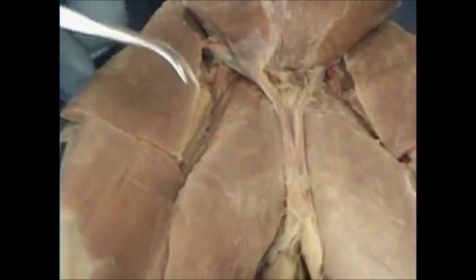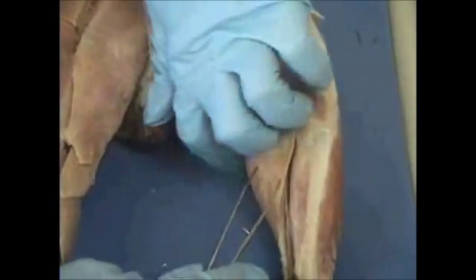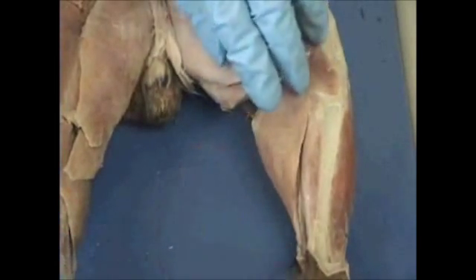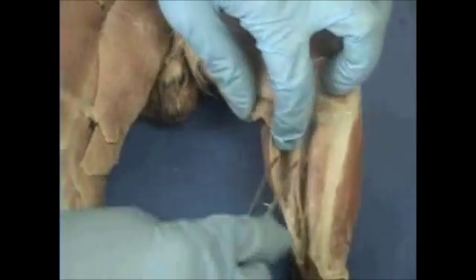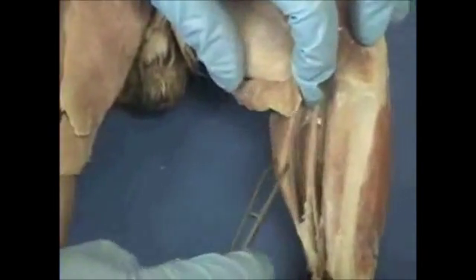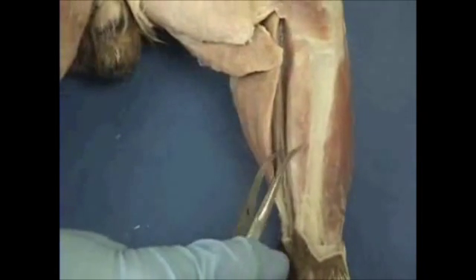Now let's take a look at the lower portion of the limb or the leg. Here we see our calf muscle known as our gastrocnemius — just like the human. The leg is the exact same as the human. So gastrocnemius, the inner portion here, and soleus.